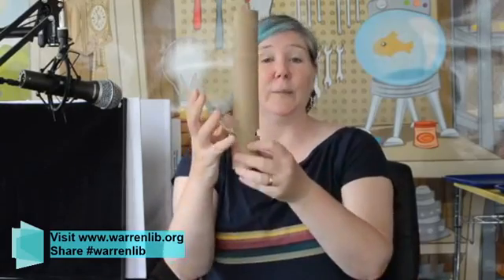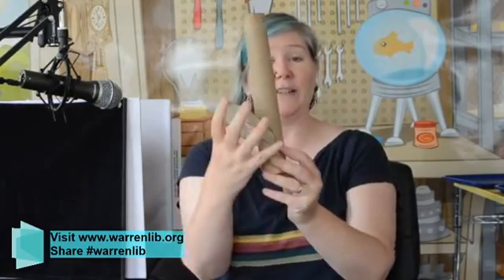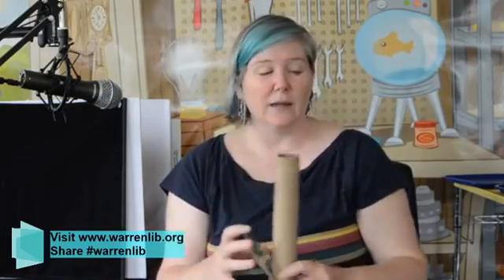All right, I'm hoping everybody's here. Let's get started with today's project. This is ultimately what we're going to be building, and it's a pretty simple device. You just are going to be looking in here, and we're going to break up light and get to see how it works. Now, that may not make sense to you, so it's not a very sturdy device. It falls over. Let me show you what I mean.